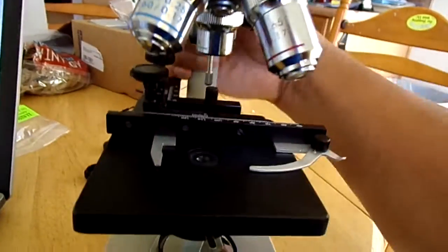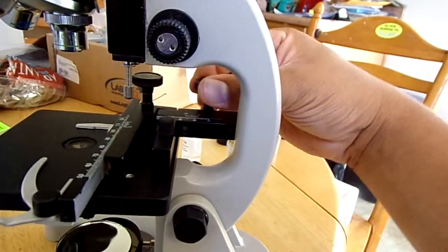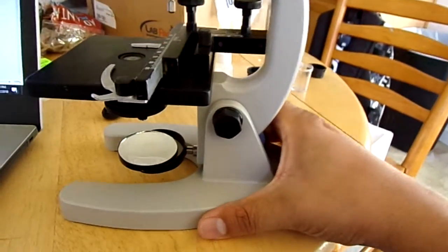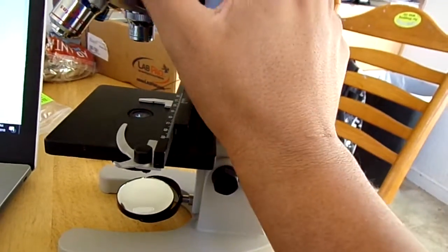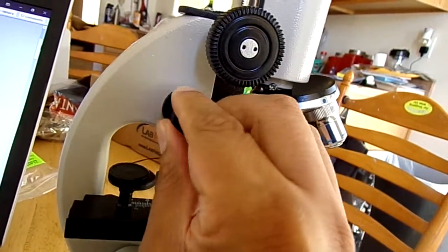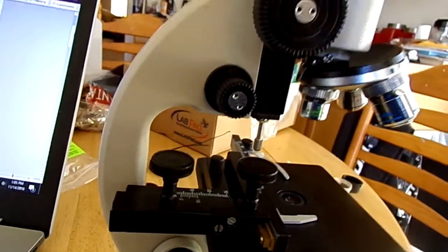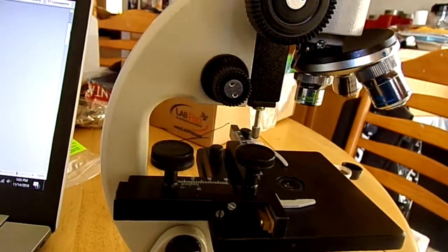And then we have our arm as we come to this view. The arm is just to help us move and lift our microscope, with the base that supports the weight and doesn't allow it to shake or move while we're looking at our subject. Then we have our focus knob, which is right here. This will allow us to bring into focus, especially on a high power view. This will clarify the picture that we're seeing.